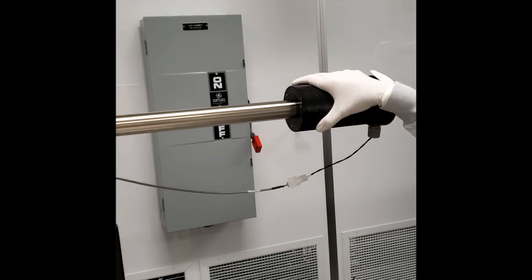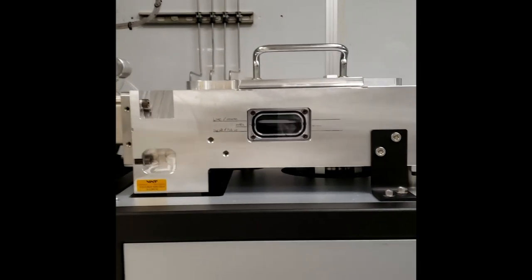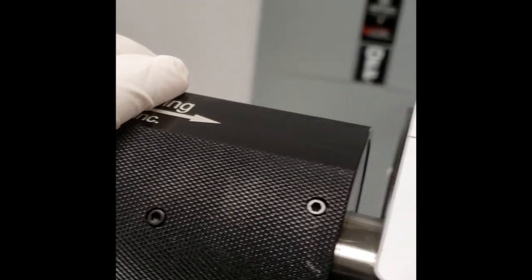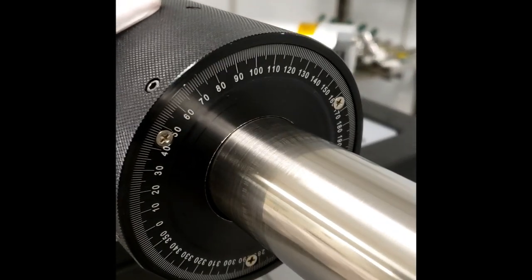The sample holder is back to the transfer chamber. Please notice the rotation of the load lock rod during the unloading process one more time. Once the transfer rod is back to the initial position, press OK.